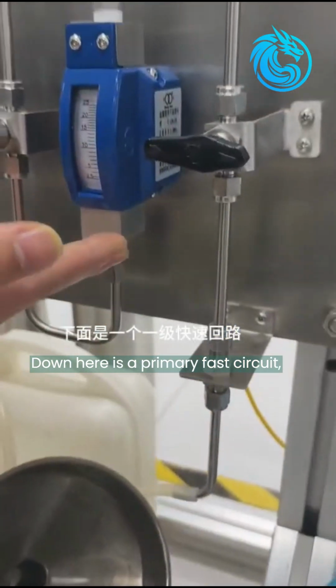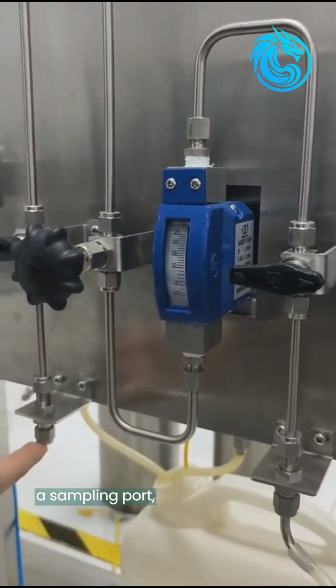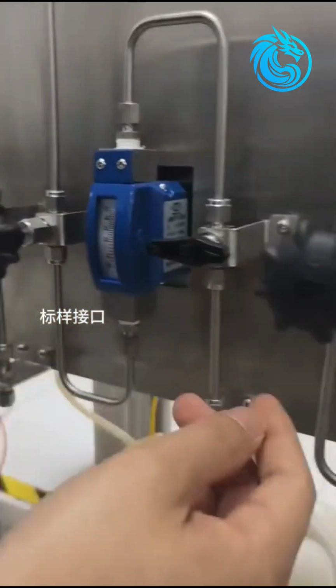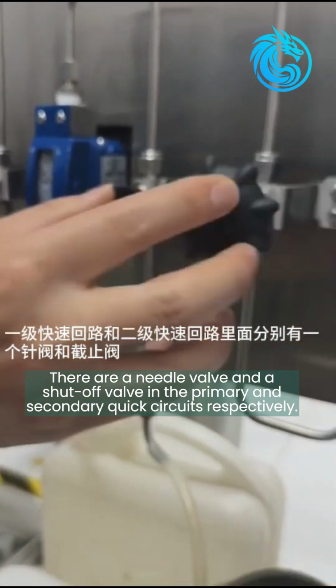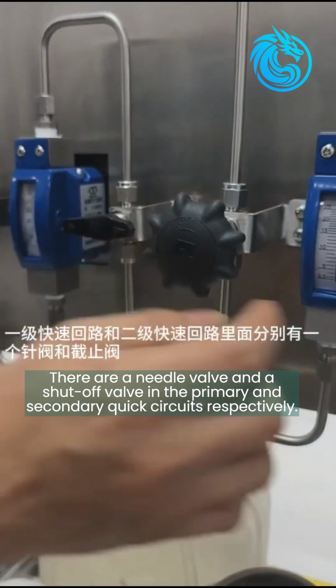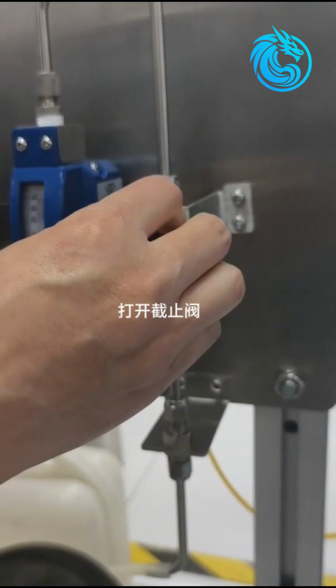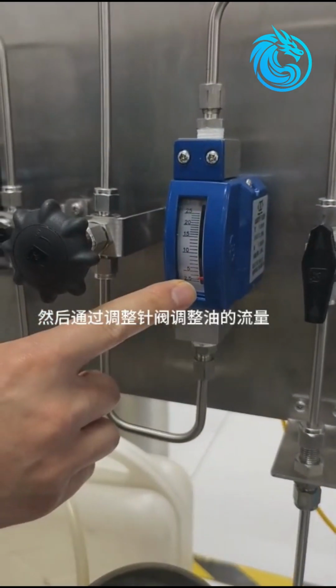Down here is a primary fast circuit, a secondary fast circuit, a sampling port, and a standard sample port. There is a needle valve and a shut-off valve in the primary and secondary quick circuits respectively. First, open the shut-off valve, and then adjust the oil volume by adjusting the needle valve.